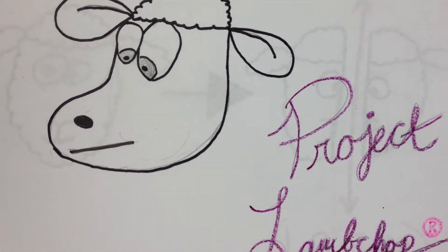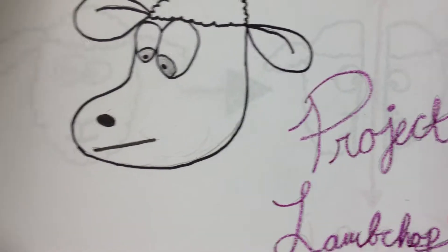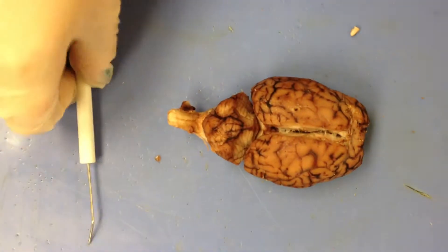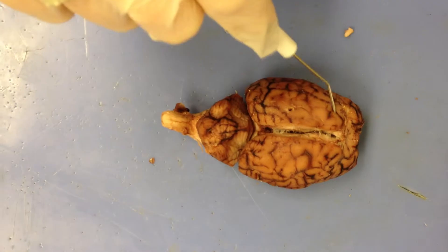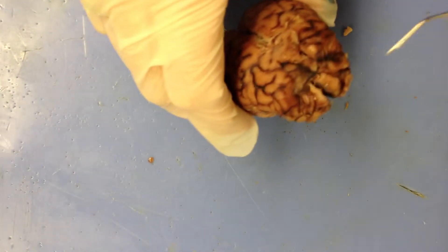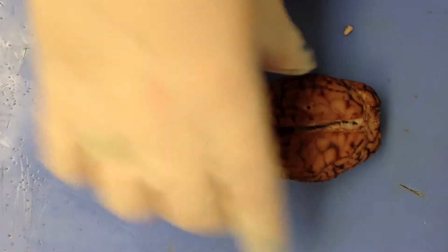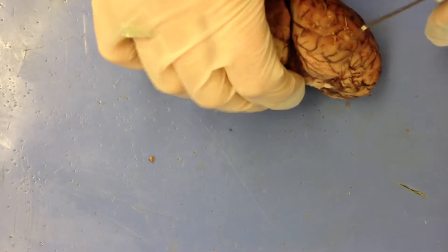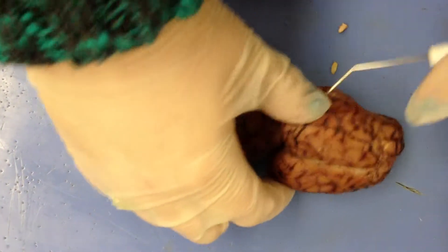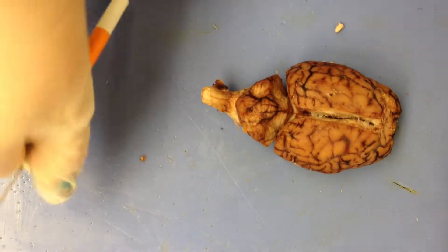Starting off with the lobes. On top right here, the parietal lobe. The frontal lobes are right here. On the sides here, we have the temporal lobes on both sides, and then the occipital lobe is in the back.